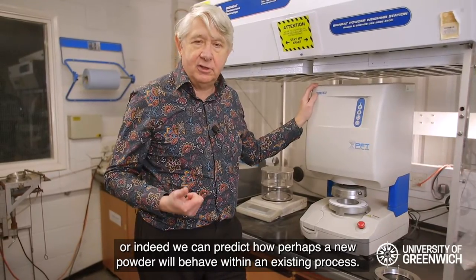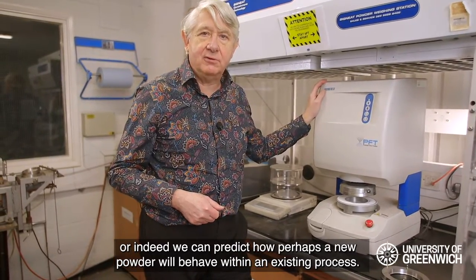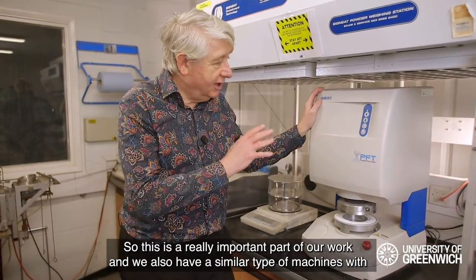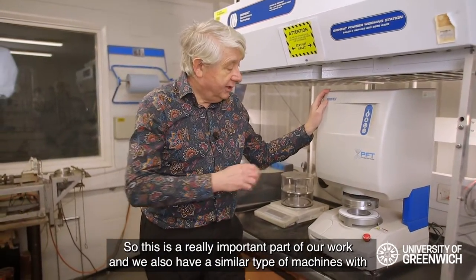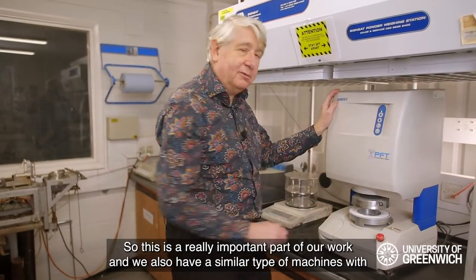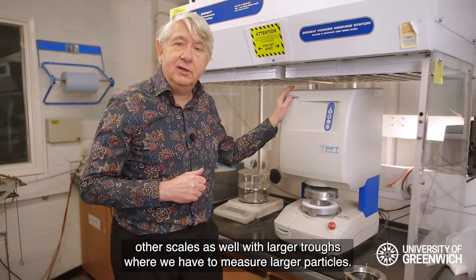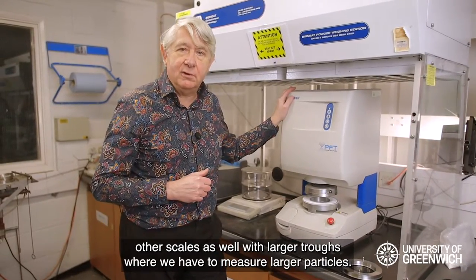With those four measurements we can undertake design of equipment for handling that powder, or predict how a new powder will behave within an existing process. This is a really important part of our work. We also have similar machines at other scales, with larger troughs, where we need to measure larger particles.